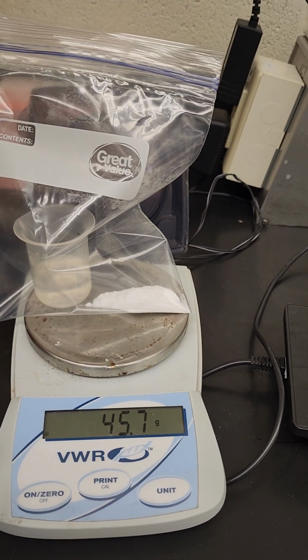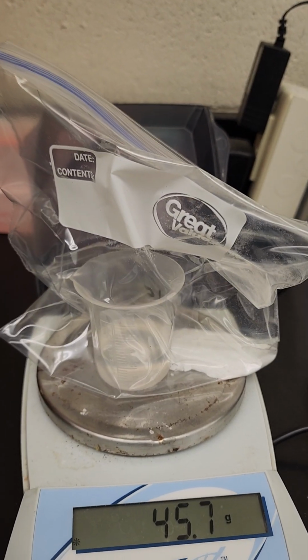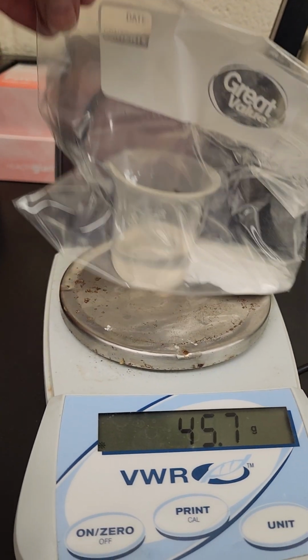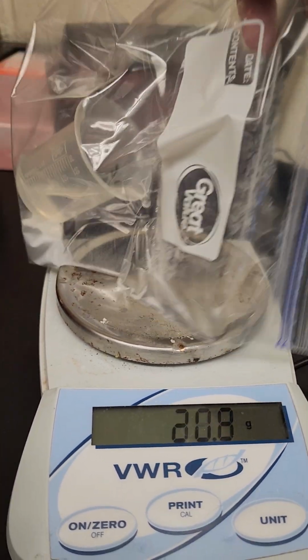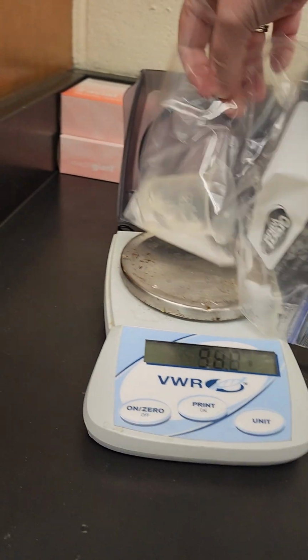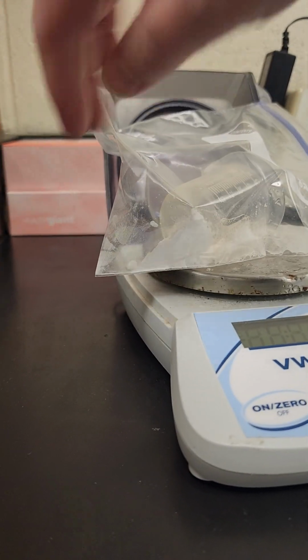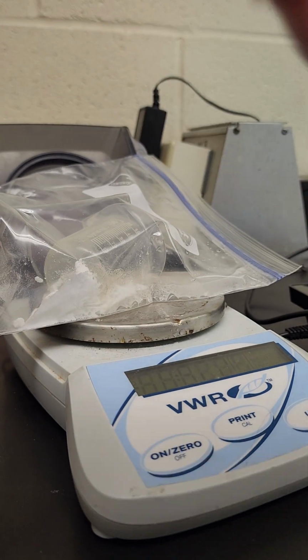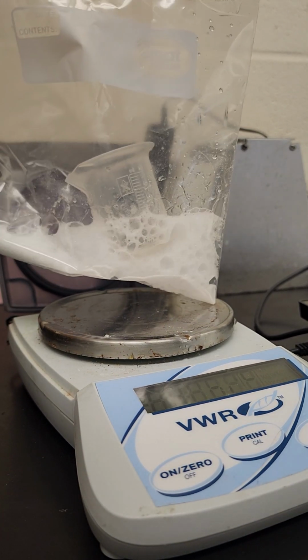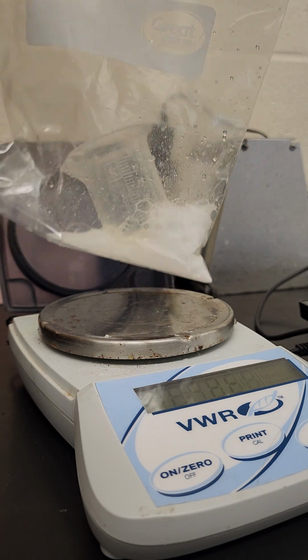It's now sealed. I pushed all the air out, and now I'm going to pour the acetic acid into the bag and let the two of them mix. Okay, so mix this around. Not that easy to do with just one hand. Let me see if I can fix this. There it goes. You can definitely see some bubbles. That was an unexpected volume change. I can hear sizzling.